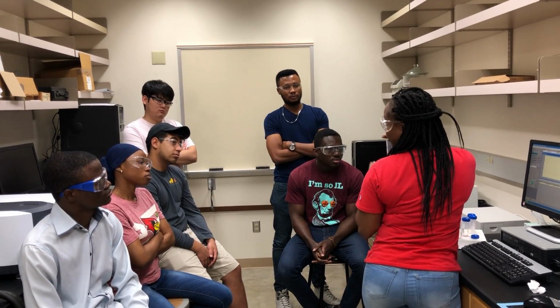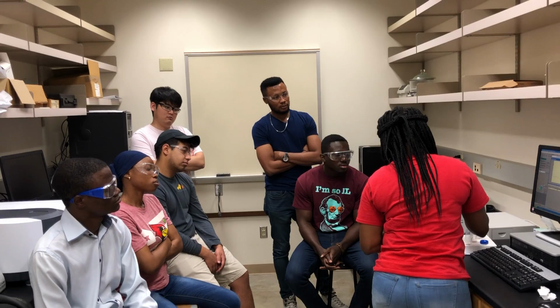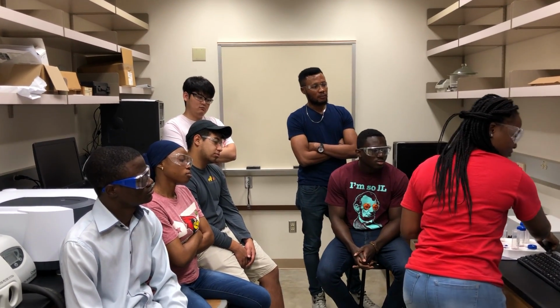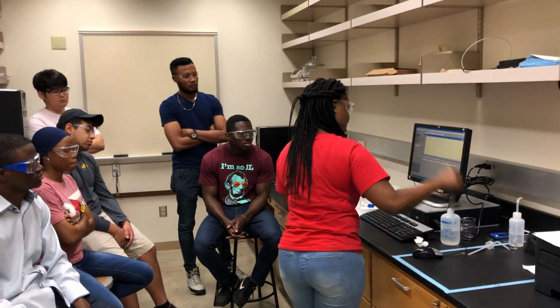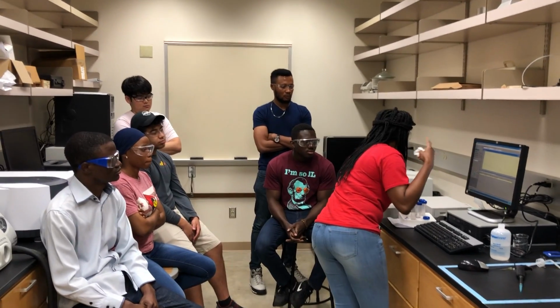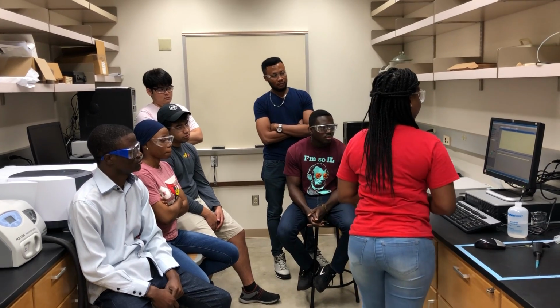This is the 250 microliter sample. Take it here. Dilute. Don't forget to wipe. It will keep resounding in your ears: do not forget to wipe.